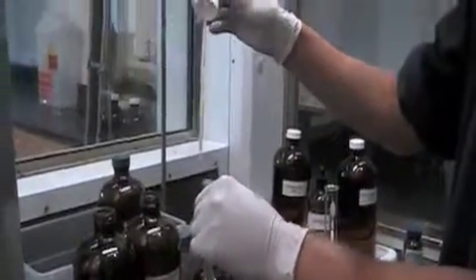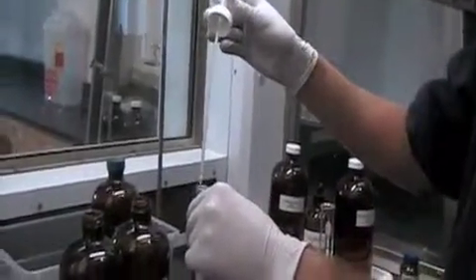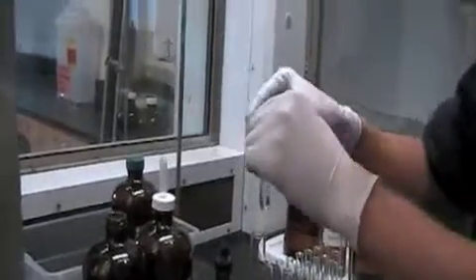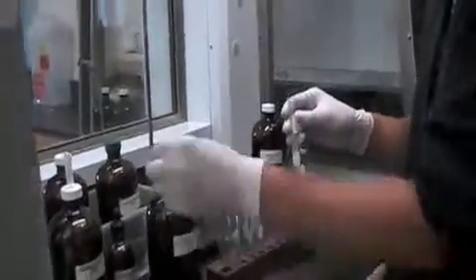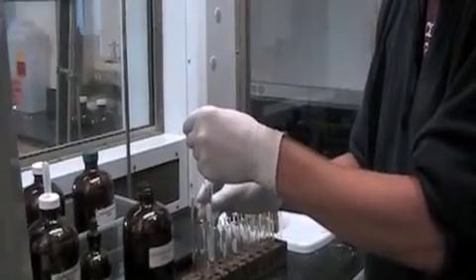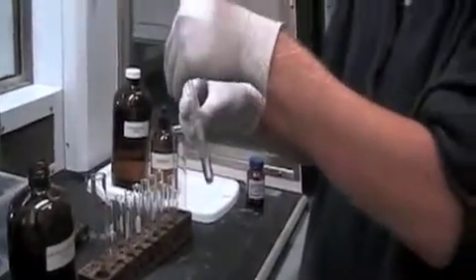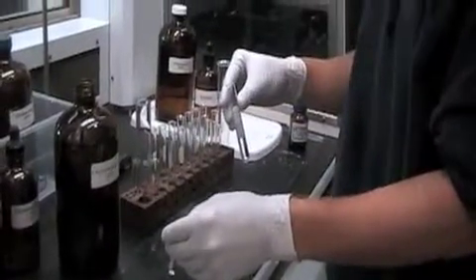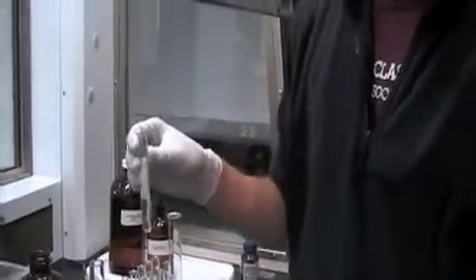Next you're going to add two drops of barium chloride, then two more, and you should record these observations in your notebook. Now with your precipitate from the barium control test, you're going to add hydrochloric acid until your solution is acidic to litmus paper. Then look to see if your precipitate has dissolved or not, and record this in your notebook.